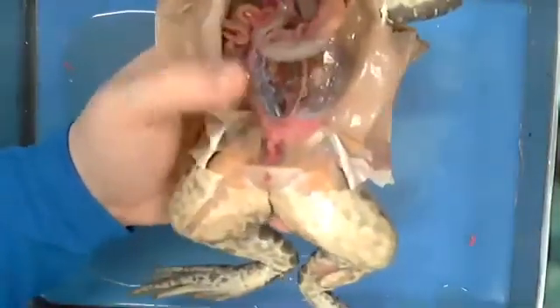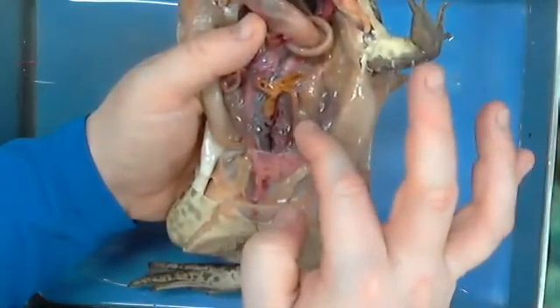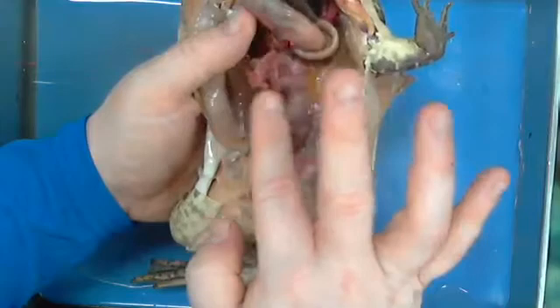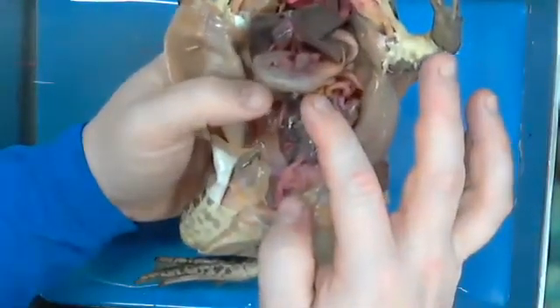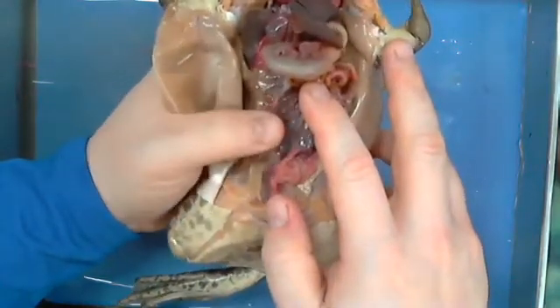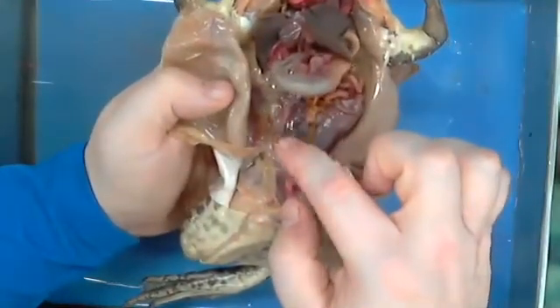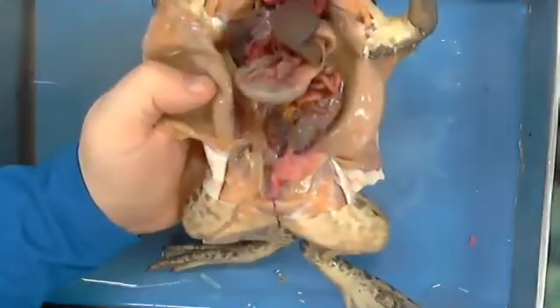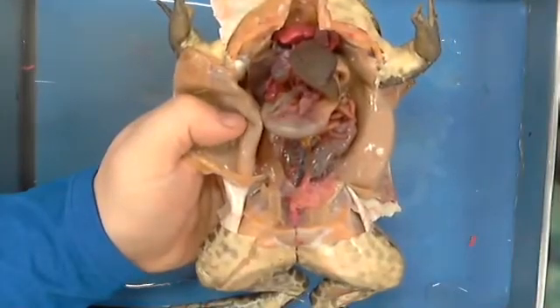All right, so here you go. So here is, again, a kidney. It's bean shaped. He has 2 of them. Its job is to filter what? What does it filter? Urine and waste. Also toxins from blood, right? All right, so there is our kidney in this case right here, okay? So you've basically seen every internal structure that exists at this point in time.